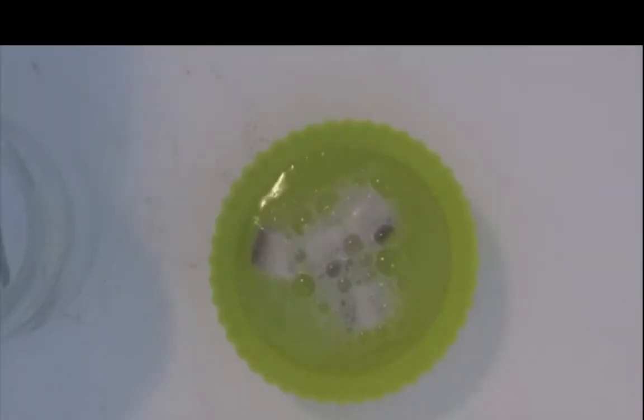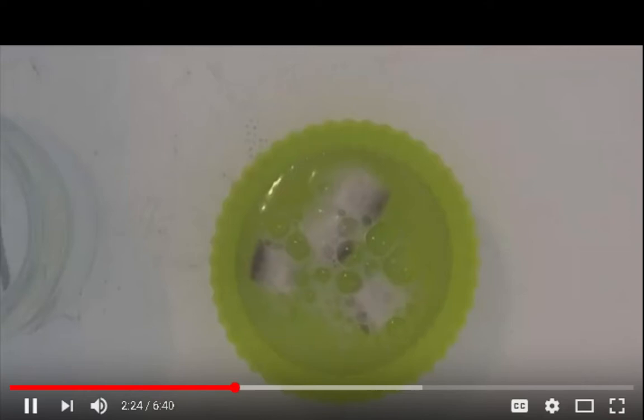Now, because the tissue samples were taken under non-sterile conditions, if you're putting them into an agar, it will most definitely contaminate, so you need to sterilize it in some way. I do this by dropping them in 3 to 9% hydrogen peroxide, doesn't really matter, and leaving them there for about 20 minutes.